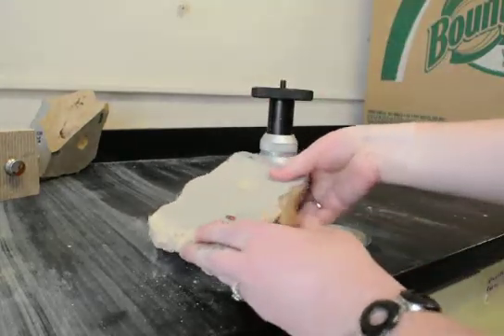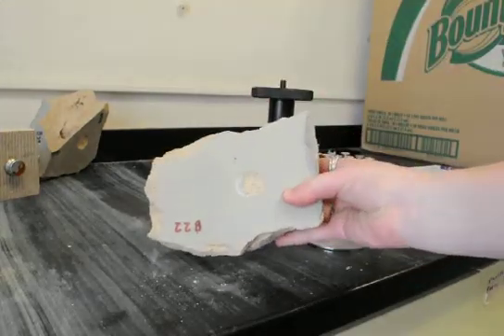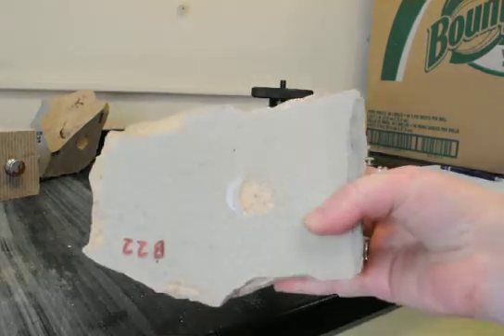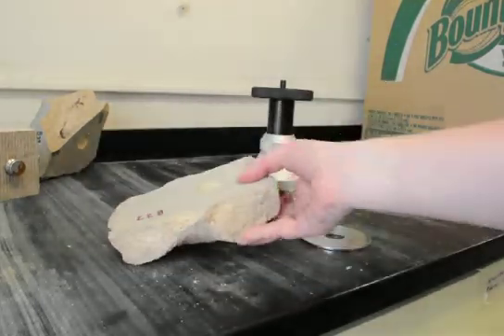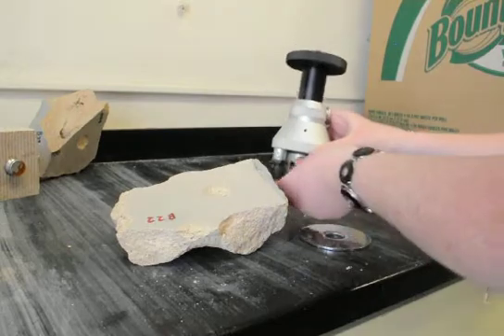And we now have a terracotta unit with glaze and clay body failure, which you can see here. And you can see how the removed material is stuck on the dolly.